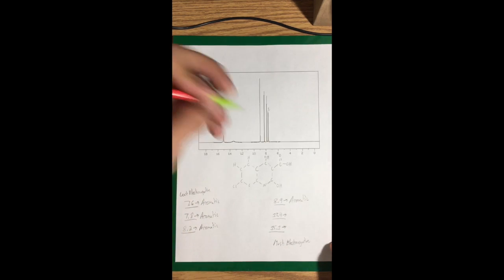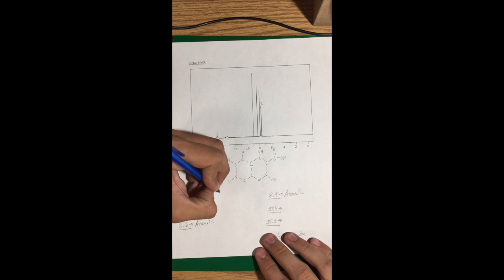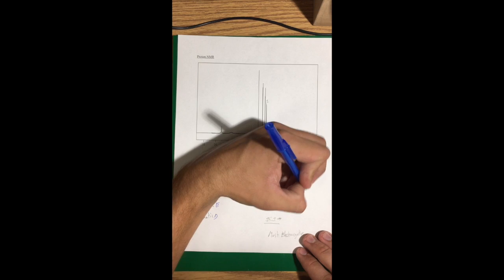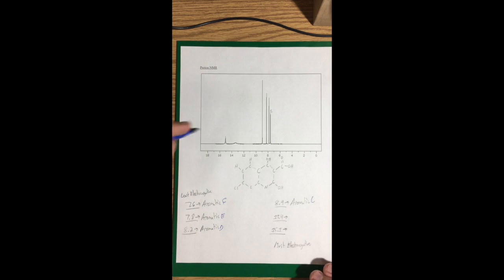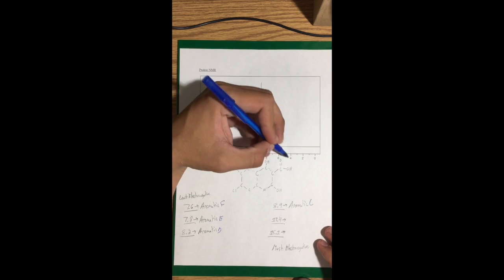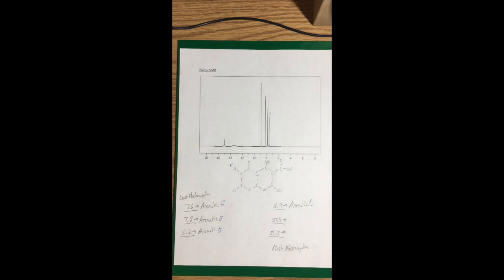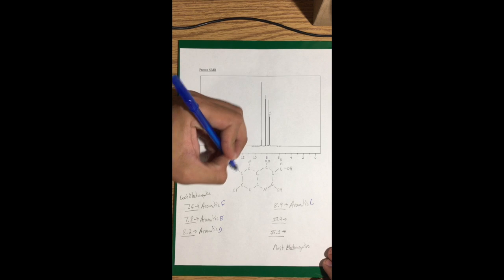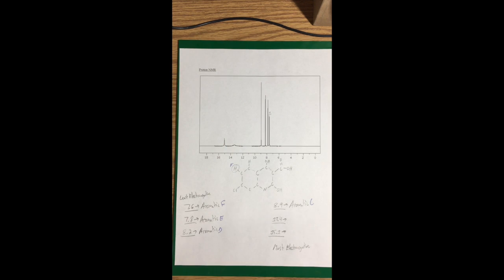And then I'm going to label them with letters so it's easier to see where these hydrogens are. This first one here is actually this one right here, farthest away from these 3 O's, which are, since they're so close together, going to be the most electronegative part of the atom. So I'm going to circle this hydrogen for you, labeled F.